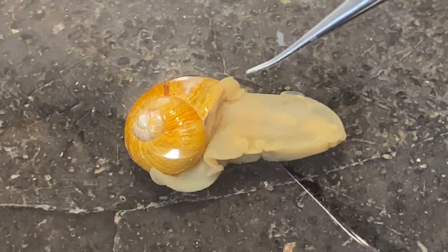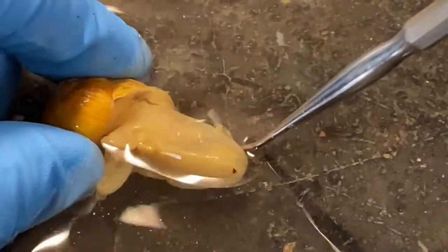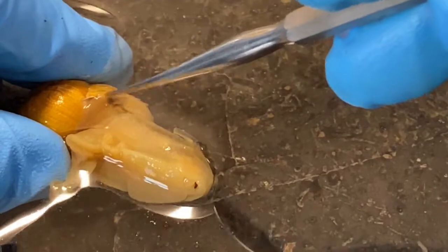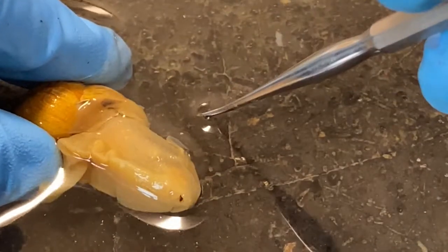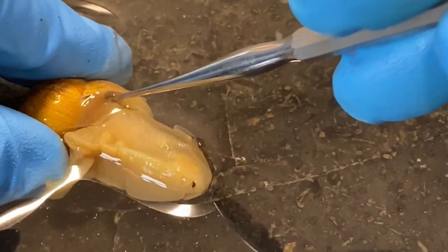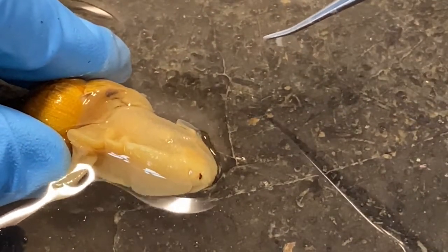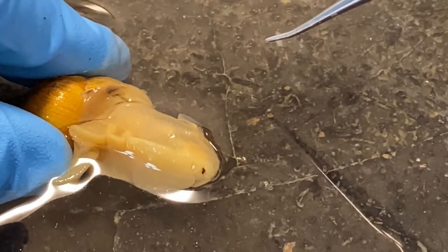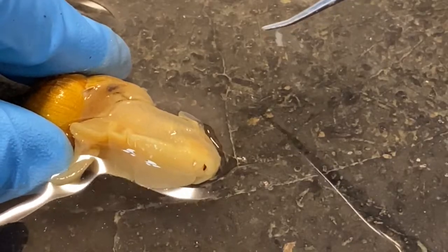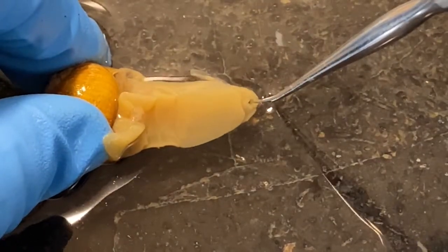Up underneath the edge of the shell is an opening called the pneumostome, and this is where this terrestrial snail draws in air and uses its mantle cavity as a lung instead of housing gills — it has vascular tissue surrounding it. So that is the external anatomy of the snail, and of course the head and mouth are here.